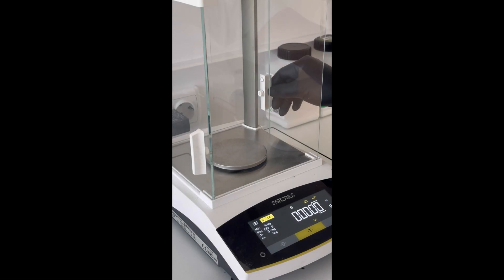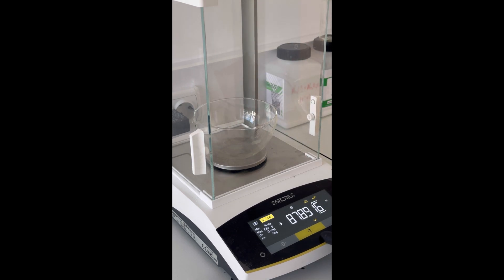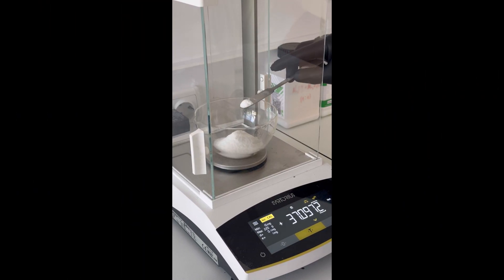On an analytical balance, we weigh 37.22 grams of the EDTA, plus or minus 0.0005.